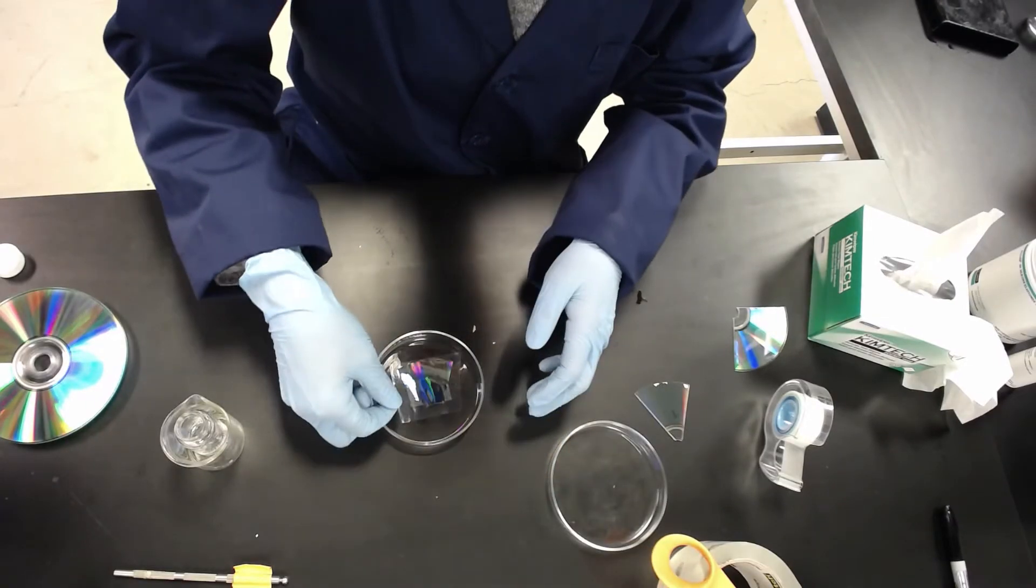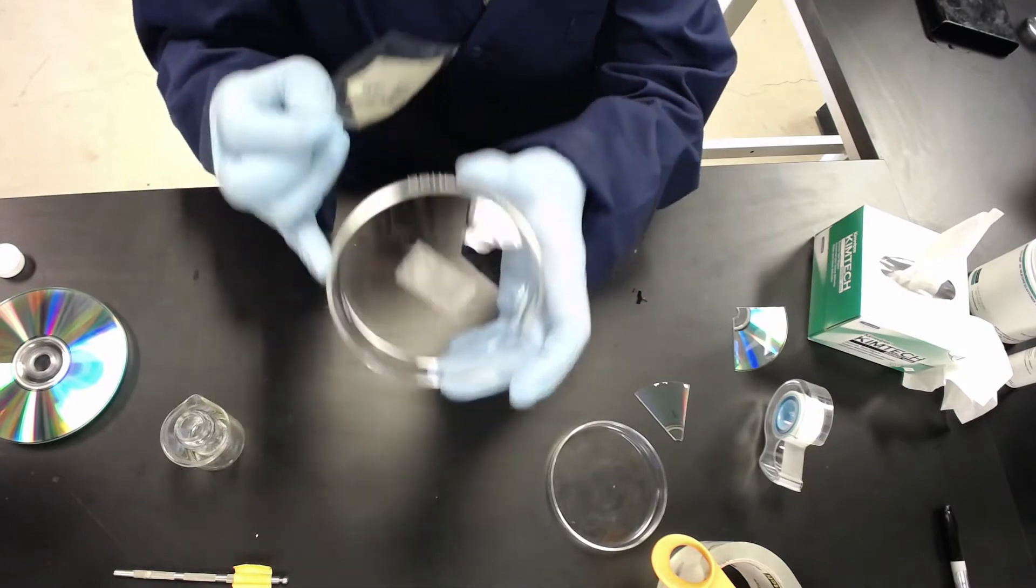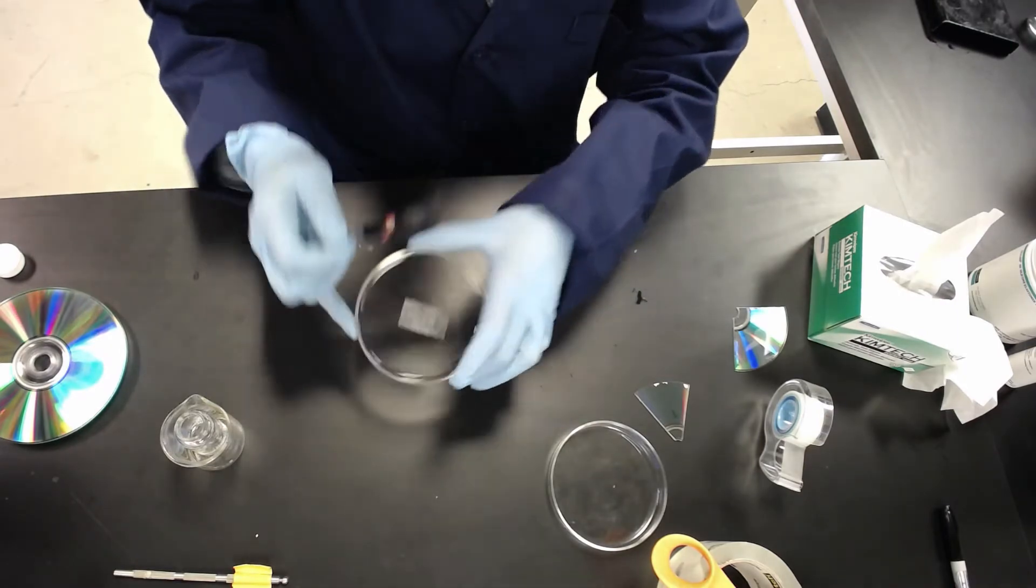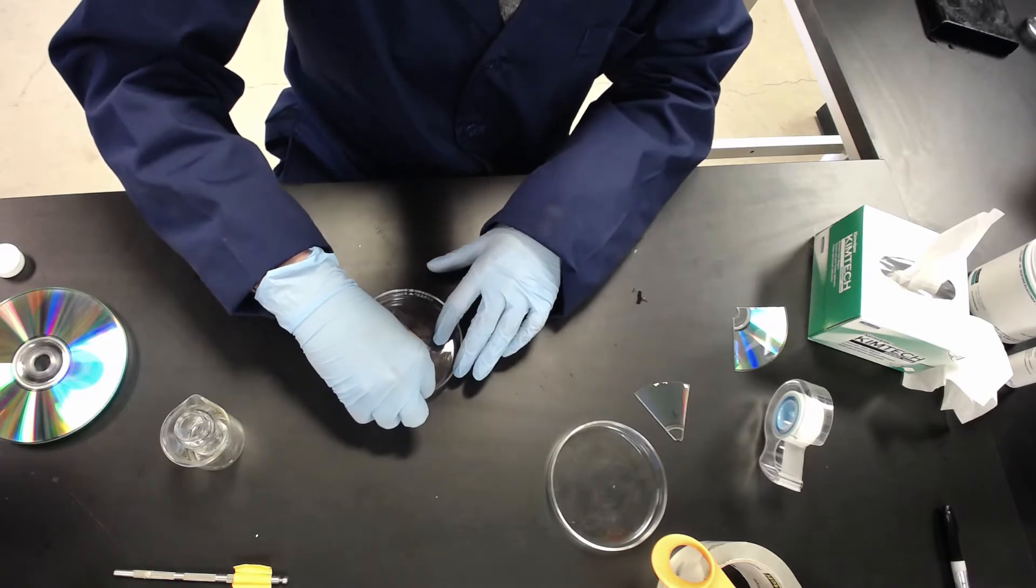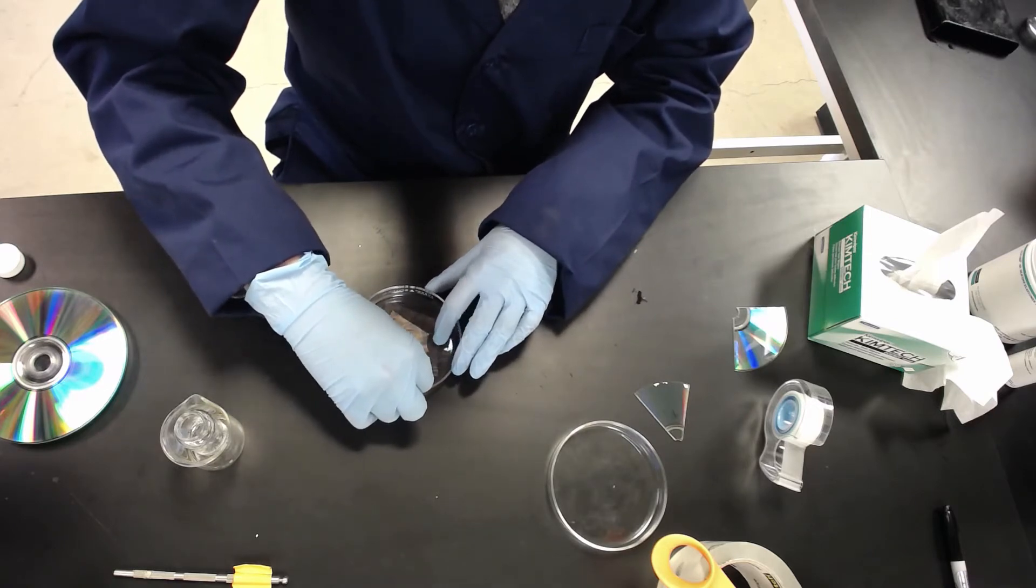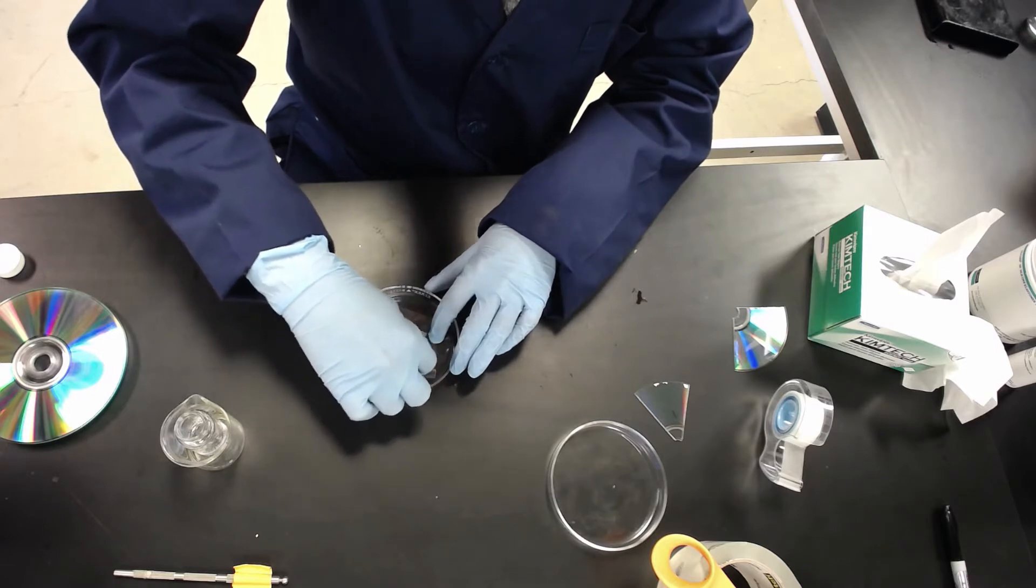Using the aluminum master. So I've already prepped this petri dish with some double-sided tape, and we're going to stick this down on it.